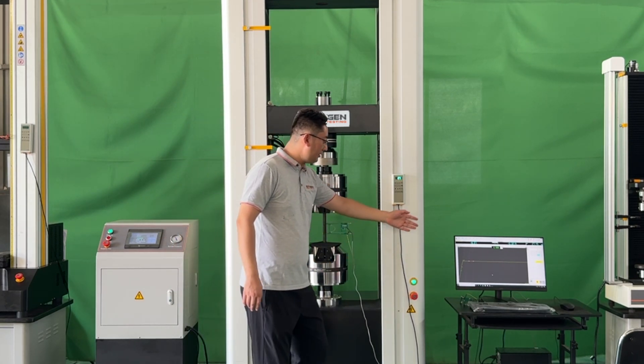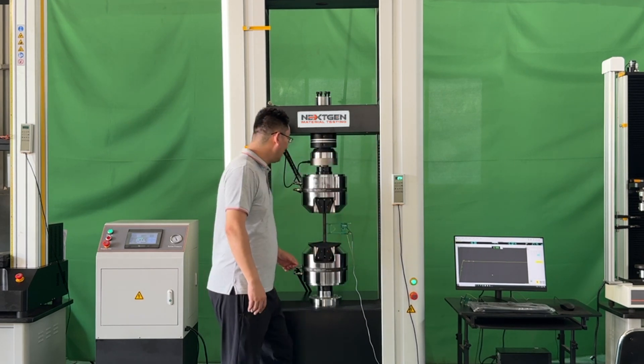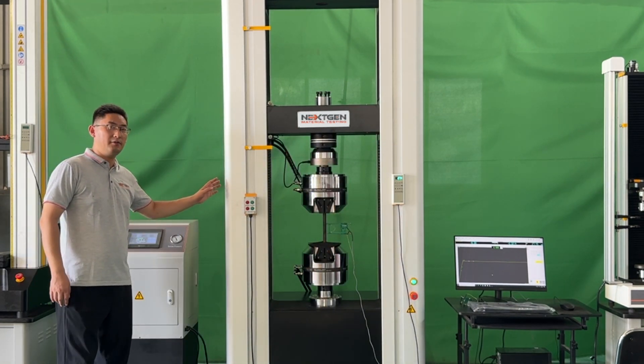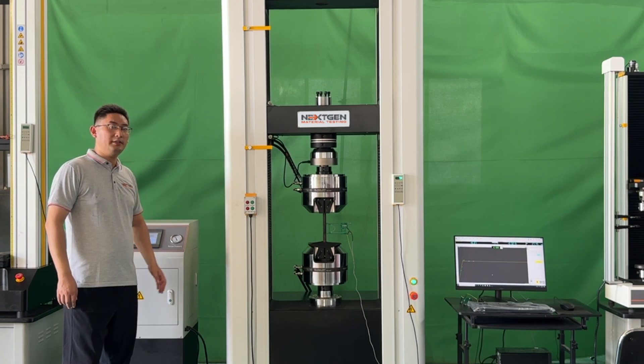This is the computer control system. The unit's power supply is 220 volts, three phase, 50 to 60 hertz.